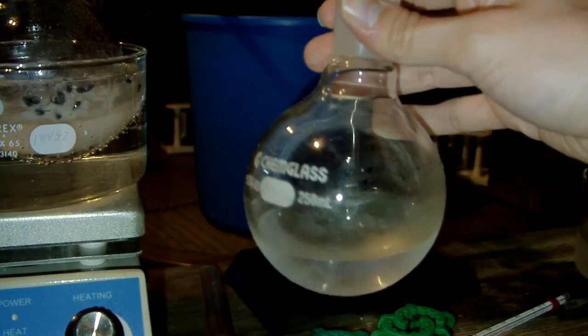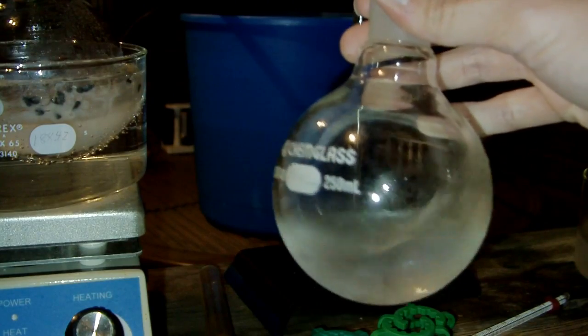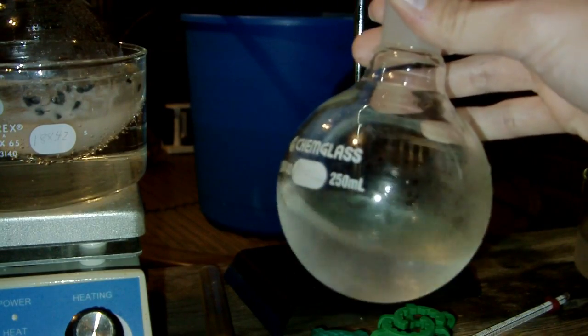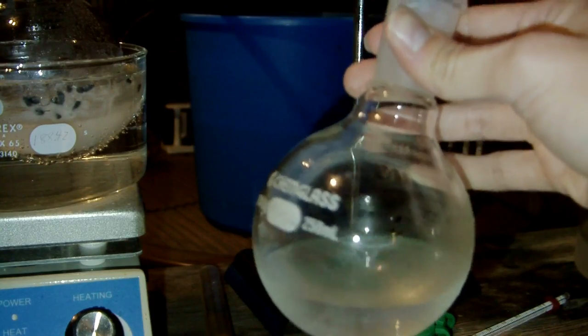So here's the product I recovered. Looks to be about 100 milliliters of liquid. And you can see it's about the same viscosity as water, unlike the stuff I started with, which was just incredibly thick and just a goop.